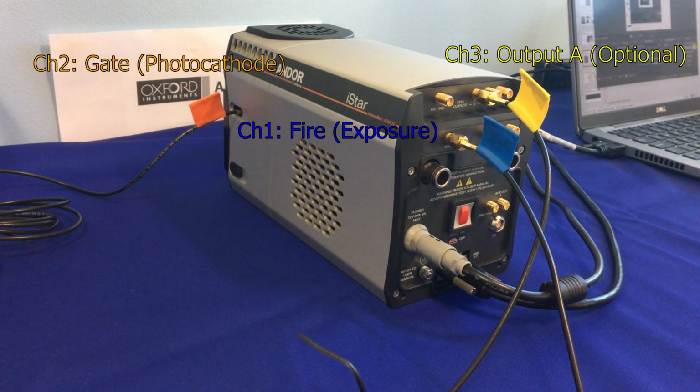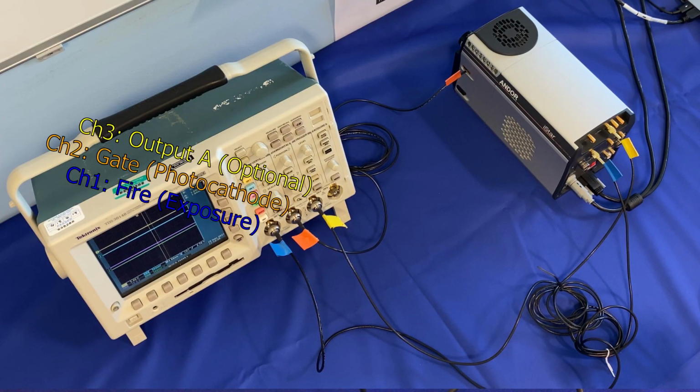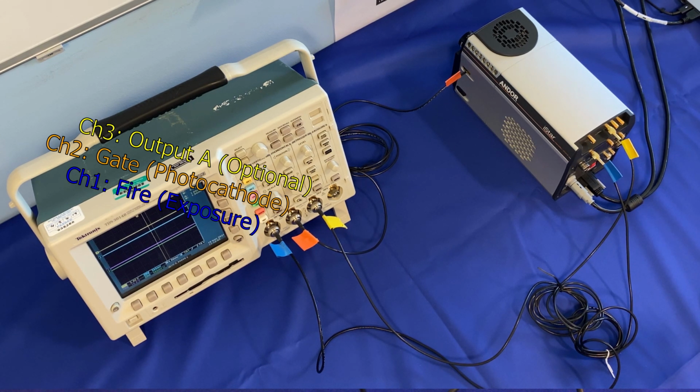So as you can see here, we have now set up our iStar sCMOS camera and connected it to our oscilloscope. You can see here the cables marked in blue are our fire pulse cables. These provide a reference signal to the display and a representation of when the sensor starts acquiring and finishes acquiring. It doesn't include readout time, but it is a mirror of exposure time.